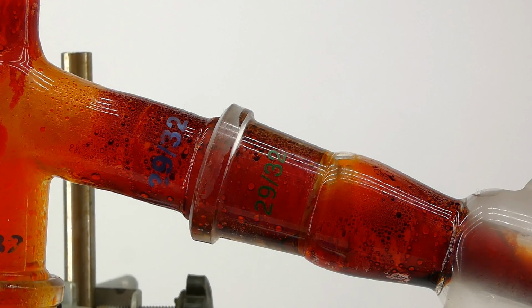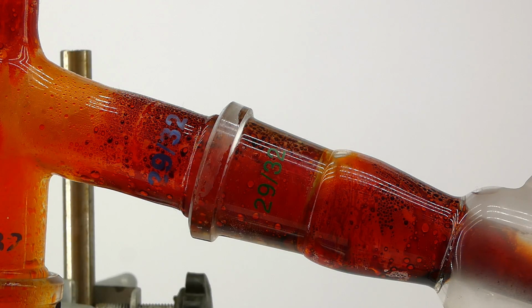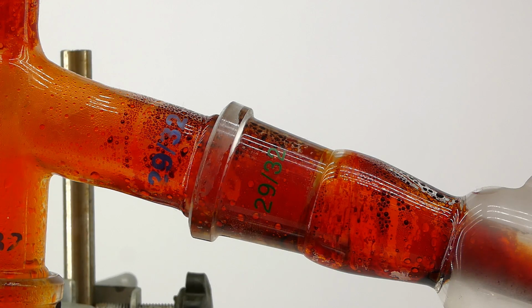Okay, so this explanation is the best I could come up with, but as I said, I couldn't find much information about some of the reactions, so a lot of this is just speculation, and you can feel free to correct me in the comments. Also, in the end, all the reaction equations don't really matter here, because bromine is being produced, and even if there is some dark chemistry voodoo magic involved in this, I won't question it.